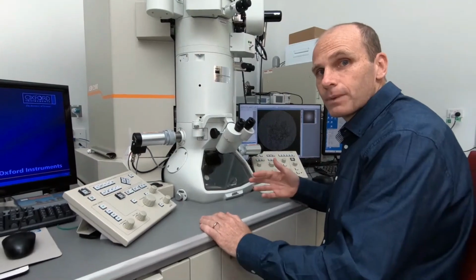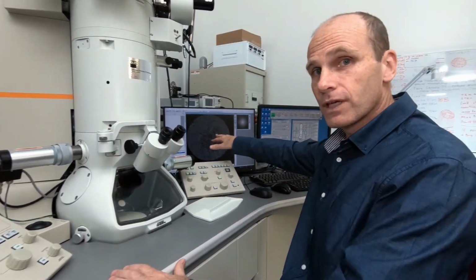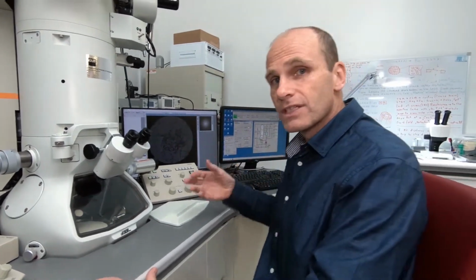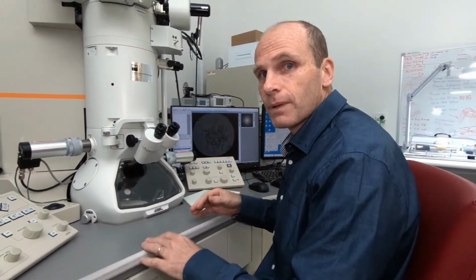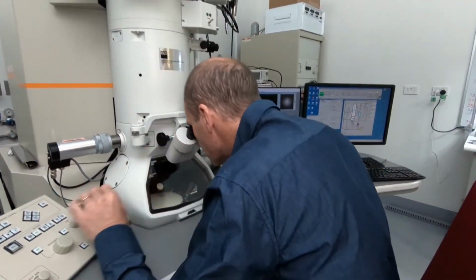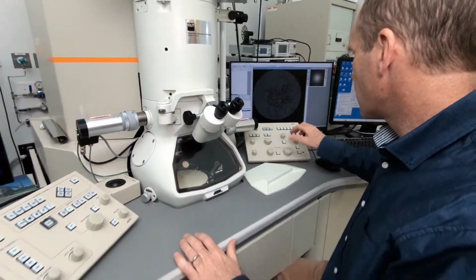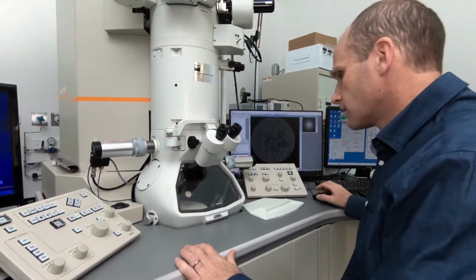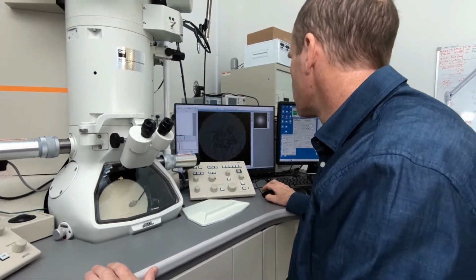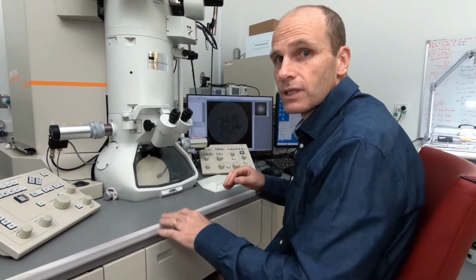Okay, so now we can set up a diffraction pattern, and what we've done is we've gotten a group of particles that you can see over here on the camera. We've aligned them up so that there's a large number of these nanoparticles that we're going to take the diffraction pattern from. So I'll set that up now on the microscope and move into diffraction mode. Diffraction mode. Okay, and so now we're going to take an image. For diffraction patterns, we often take a longer image because there's a large dynamic range that we need to capture.